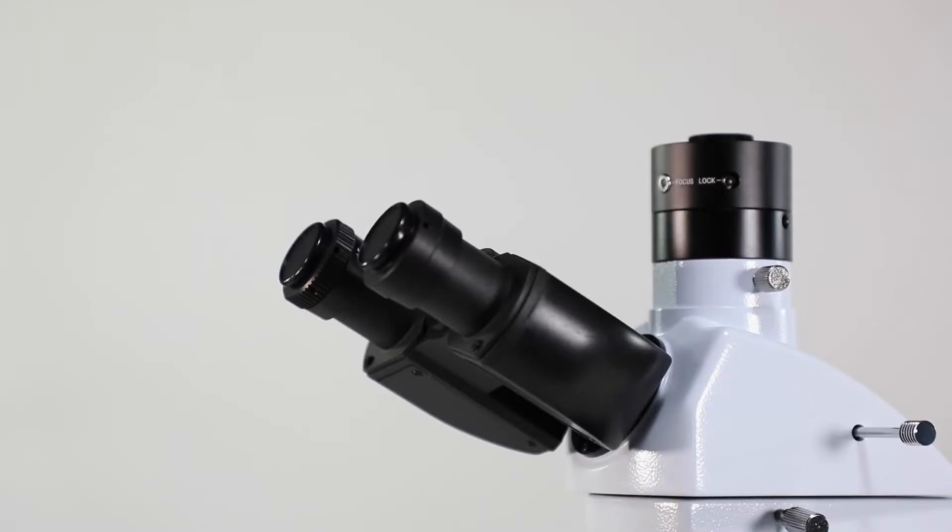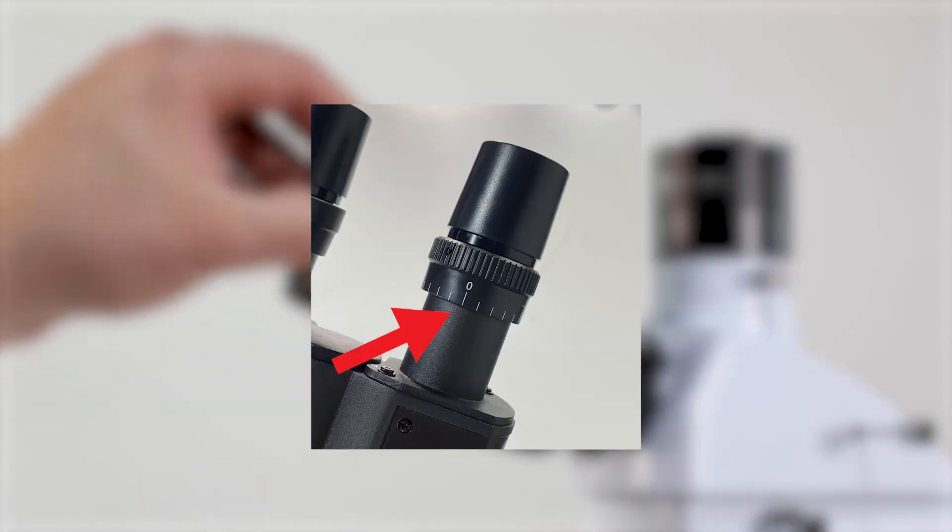Now we'll install your eyepieces. Remove the caps from your eyepiece slots and slide in your eyepieces, making sure that your diopter is set to zero.